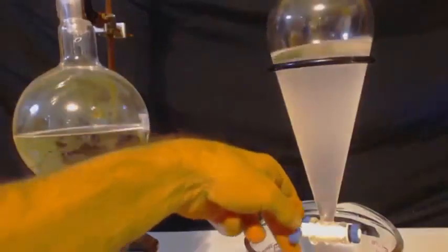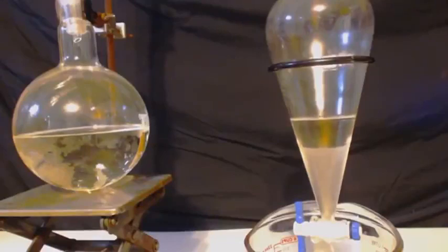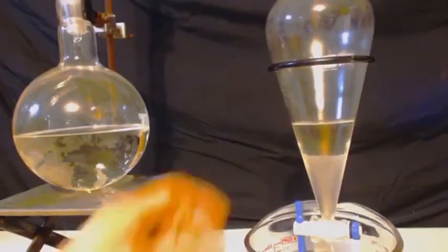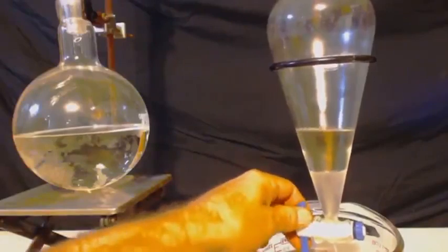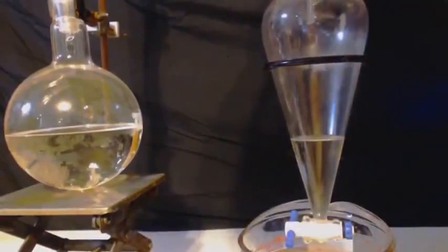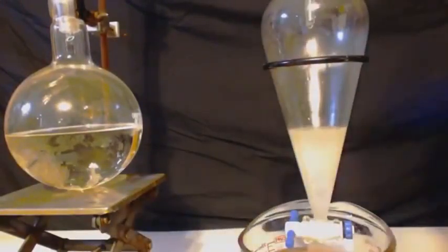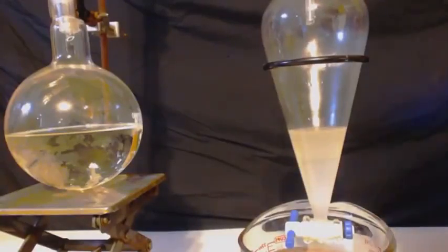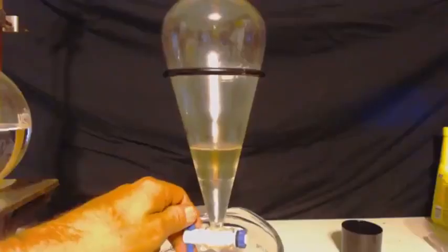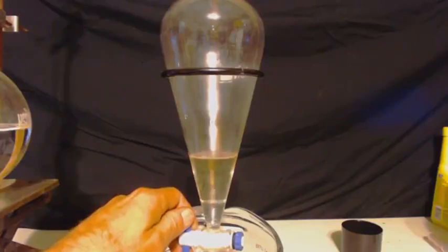Here we go. This is the second half of the can. I put some water in there, and you can see it's draining out. But like I said, one wash will never be enough. So it's always good to at least do two washings. Look again, I only put a little bit of water in there, but look how much that bottom layer is. It's pretty big for just putting a little bit of water in.